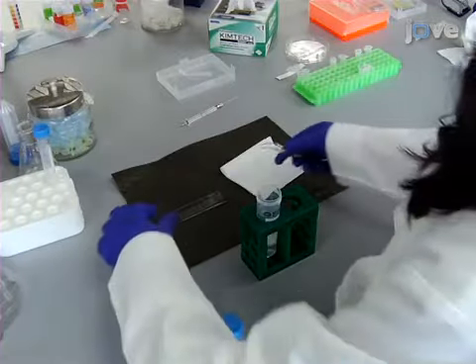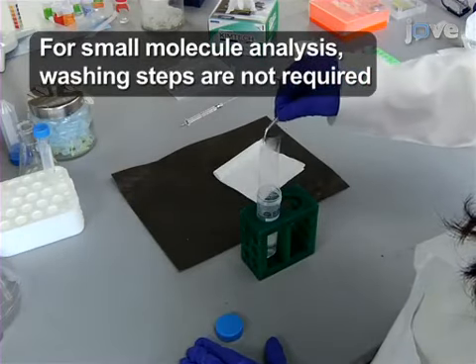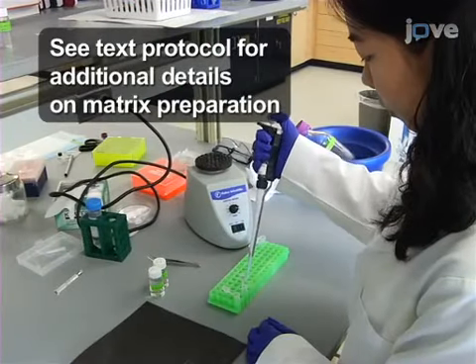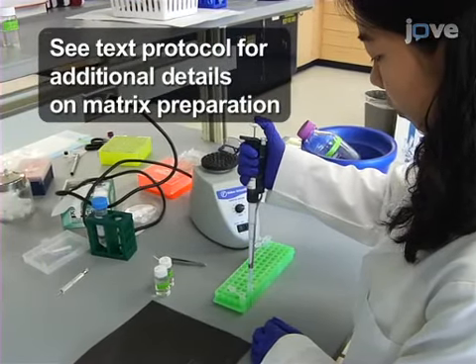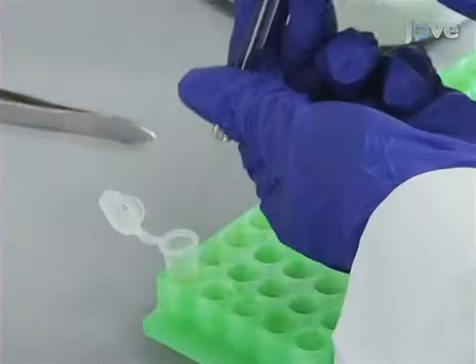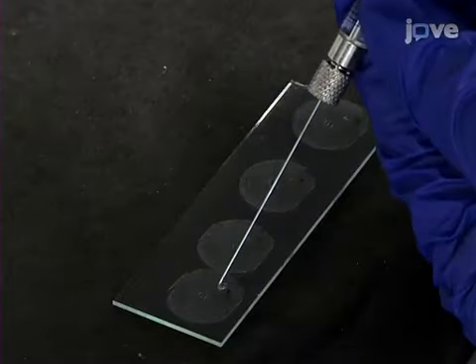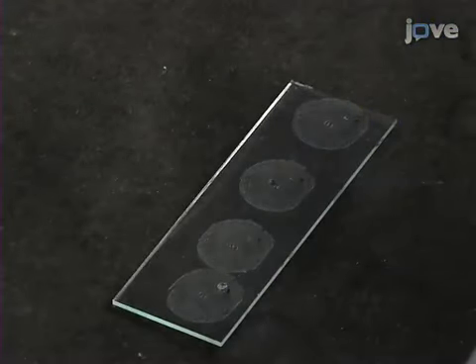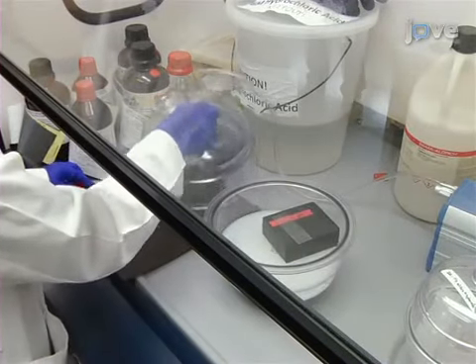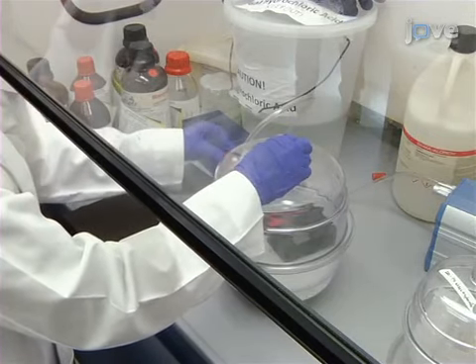For intact protein detection, wash the slices in cold acetone to remove small molecules such as lipids that could mask the signal. Prepare the matrix in a solution of organic solvent and water with 0.1% trifluoroacetic acid. Use a fine-tipped syringe to apply 0.5 microliters of the matrix solution on the three-dimensional cell culture slice. After allowing the matrix to crystallize, dry the slides in a desiccator for at least 30 minutes prior to MALDI-MSI analysis.